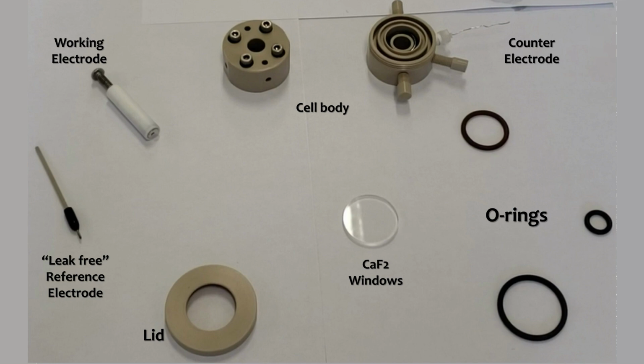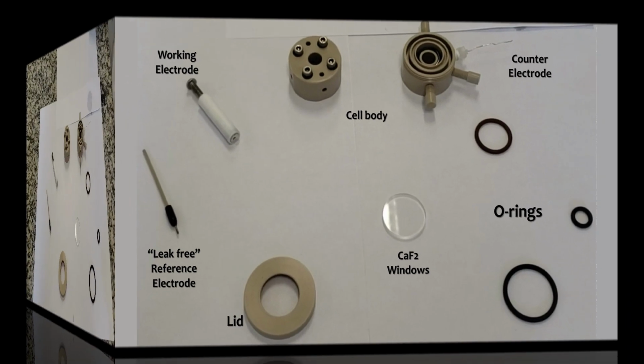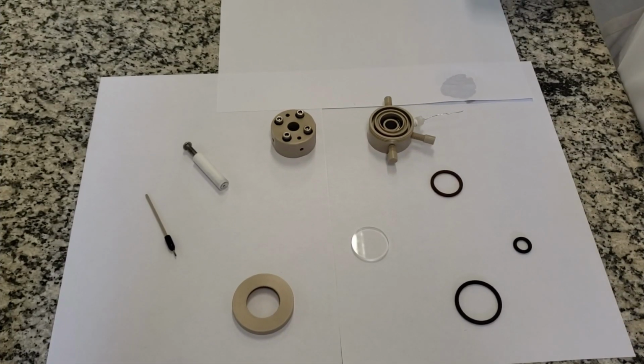Starting from the left and going clockwise, we have the reference electrode, the working electrode, the two compartments of the cell body, one containing the counter electrode, the O-rings, the two bigger to adapt the windows and the smaller to avoid leaking between the two compartments of the cell body, then one of the many windows that we can adapt to this cell, and finally the lid to attach the window to the cell.